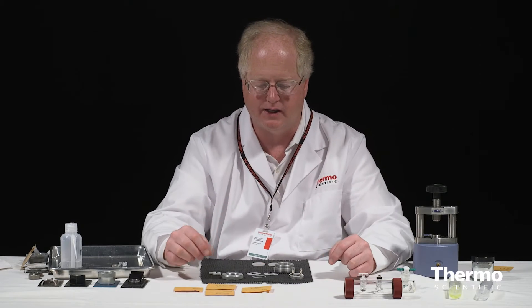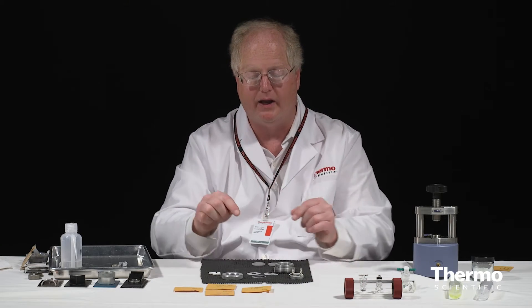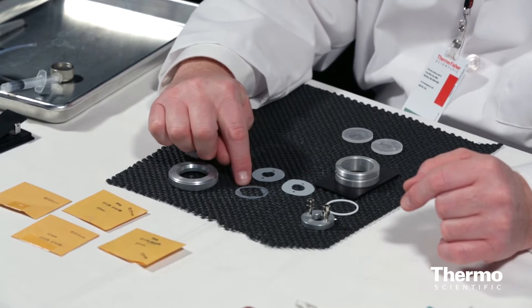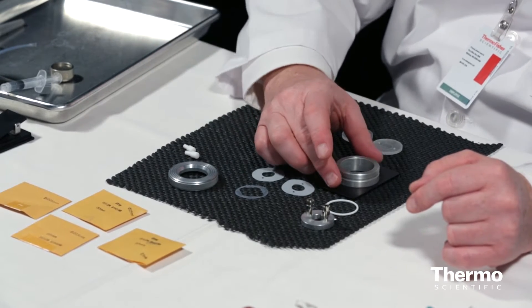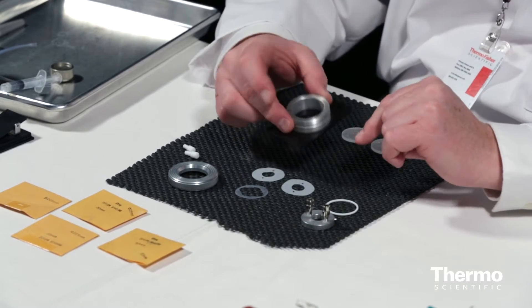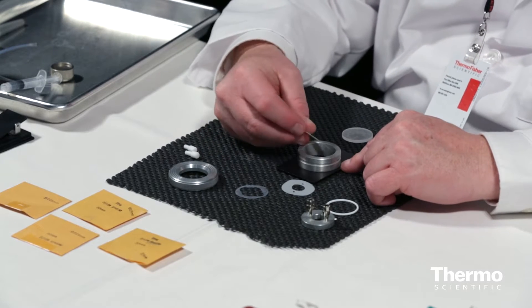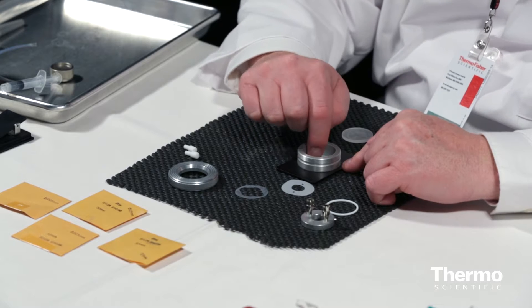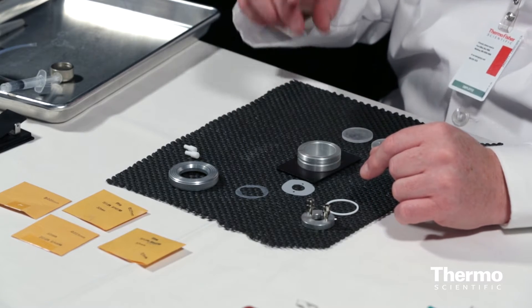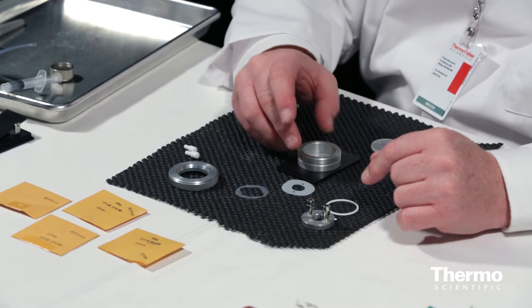There are also various designs where you have adjustable or variable path lengths. The overall idea is to get the cell assembled with the two windows trapping a gasket in between, and a spacer that sets the critical variable. The first part is the base plate — I'm going to insert a teflon spacer so that the bottom window is sitting against teflon, not metal.